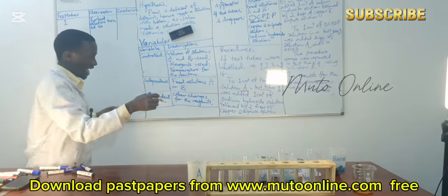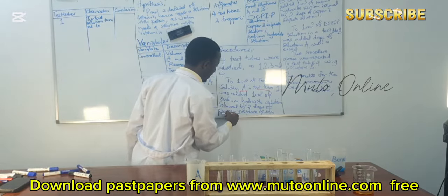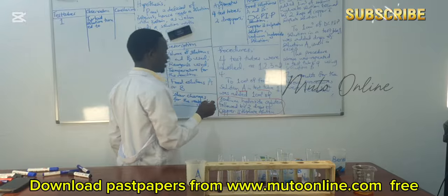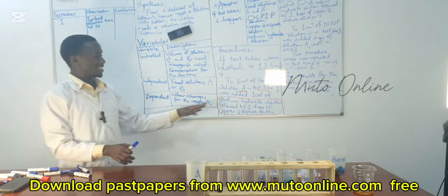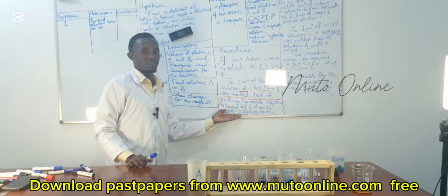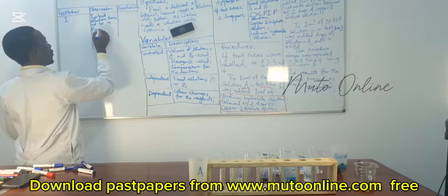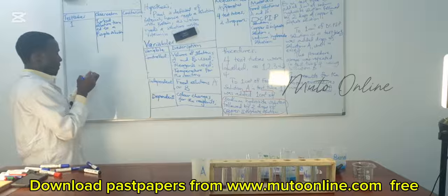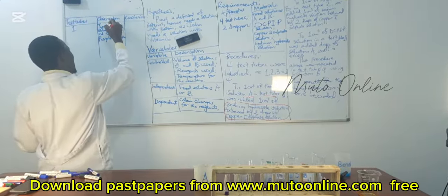When we added the reagent, because the second test in the procedure is adding the reagents, we count what it turns to when we add all the reagents. And the observation written in the Biuret test is what it turns to when we add the final reagent, which is copper 2 sulfate. So it turned into a purple solution. Members, please and please and please state the nature.